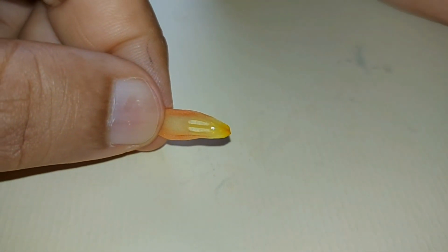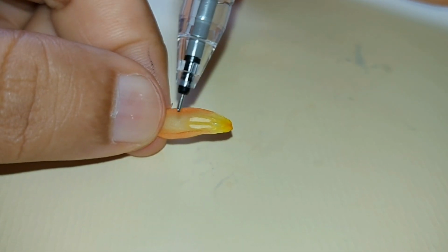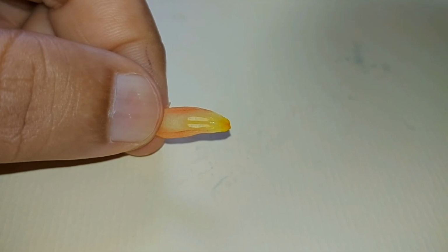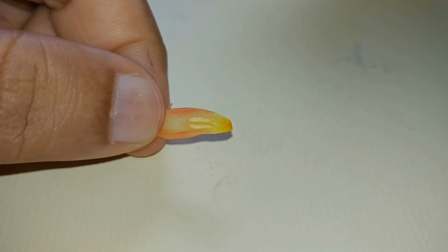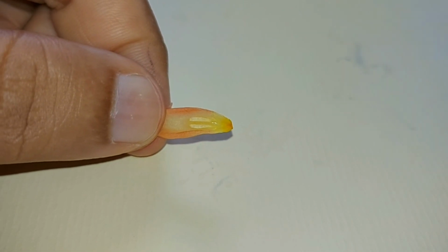Now also absent here are the filaments. Okay, the filaments are not developed yet. So what I've done here is actually dissect an unbloomed flower. So most of the components of the flower you'll see are undeveloped.